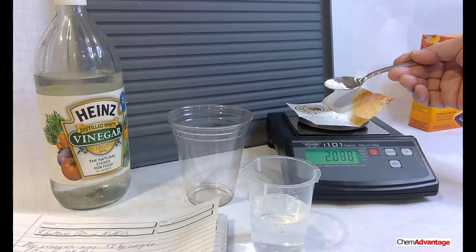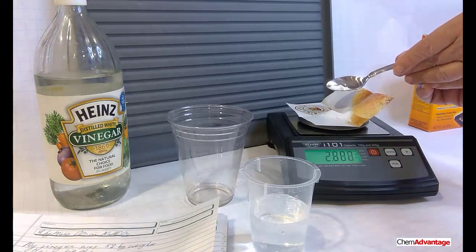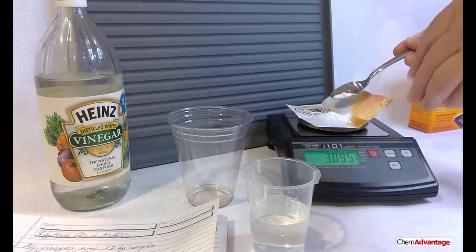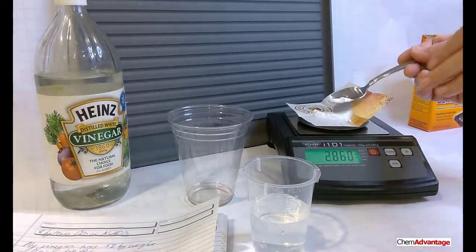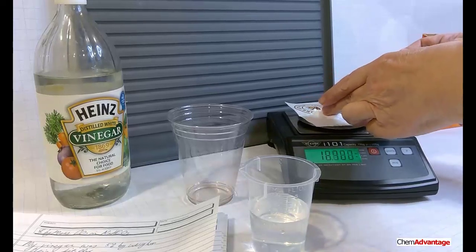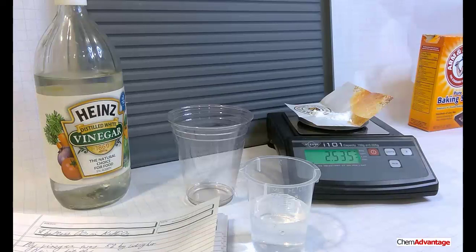this is going to be 2.0, 2.1, 2.3, it's a little bit in excess. Let's get it closer. 2.5. There we are. Oh, 2.535. I'll leave it right there. Okay, that's lucky. I'd accept 2.6, 2.7, 2.3. All those would be fine. Okay, 2.540.